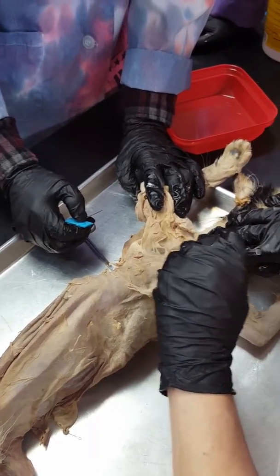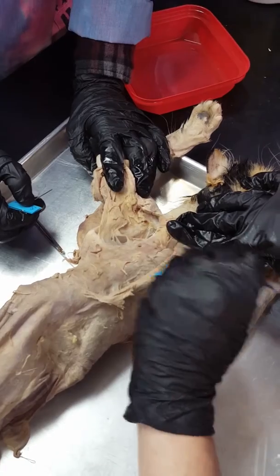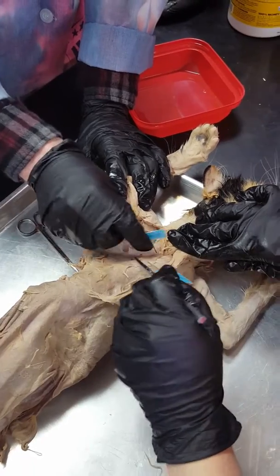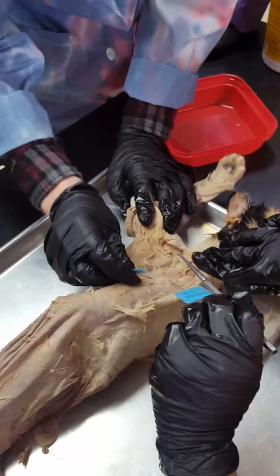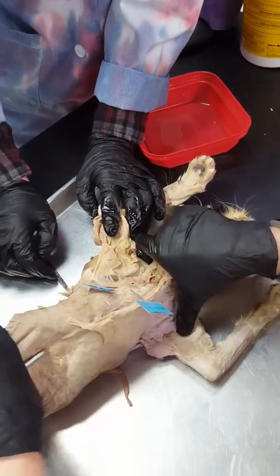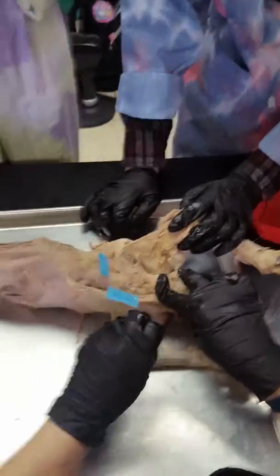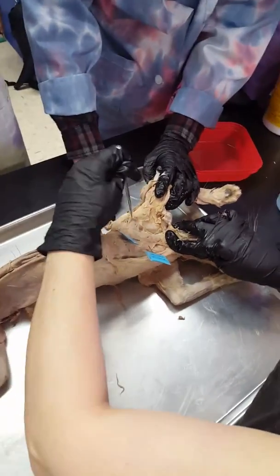So now we've got our turkey foot. If you look here, there's one, two, and then the other one is right here — three. There are three pieces to scalenus, but I always tag it here in the big thick part because this part all the way down is scalenus. That's scalenus. Now transversus costarum — what I tagged was actually external intercostals, but this is transversus costarum and this is scalenus.